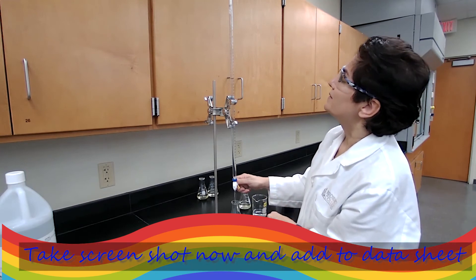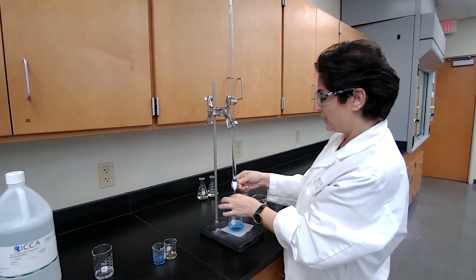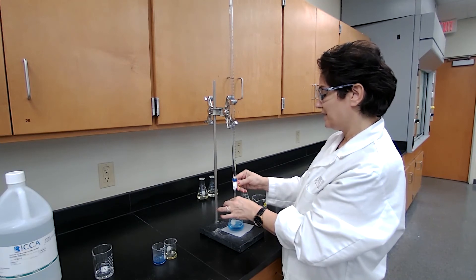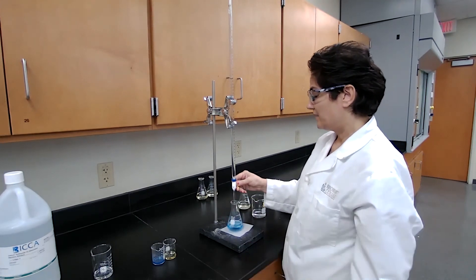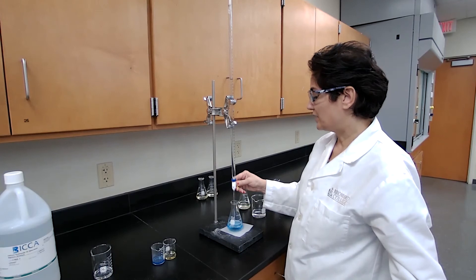And after the 20, I'm going to add one drop at a time or slowly one drop at a time until I get to the color change.